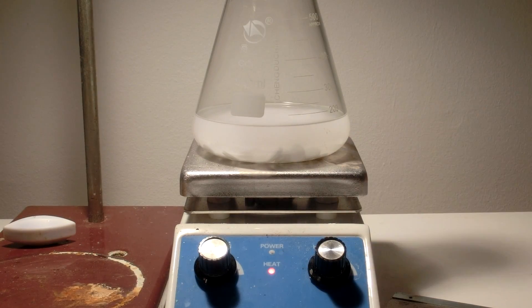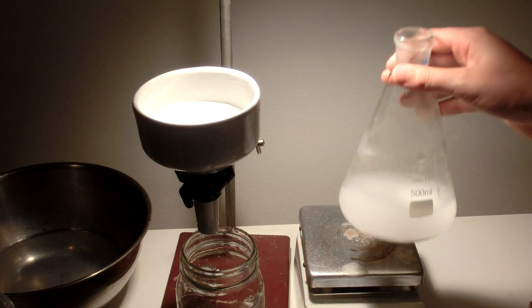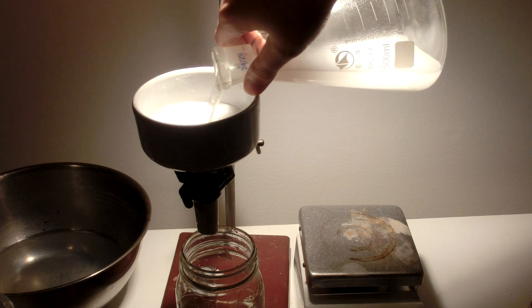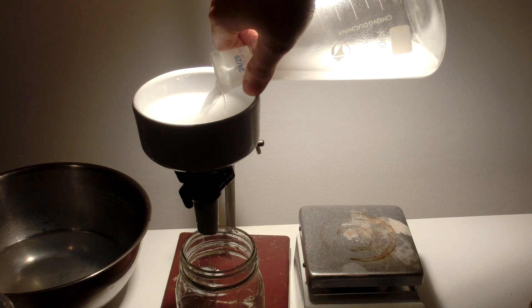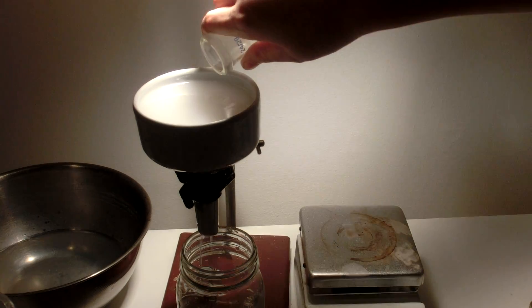Add this to a hot plate and turn it on medium heat. After about an hour on medium heat, the mixture should be removed and filtered. This filter will remove binders and other contaminants.